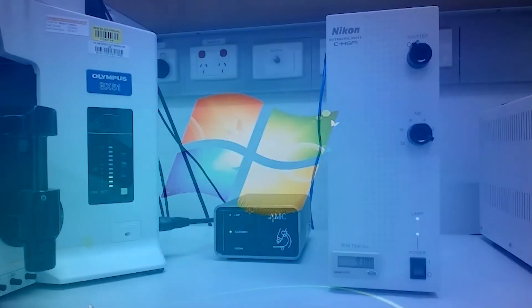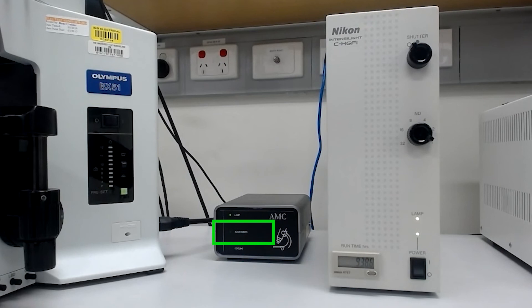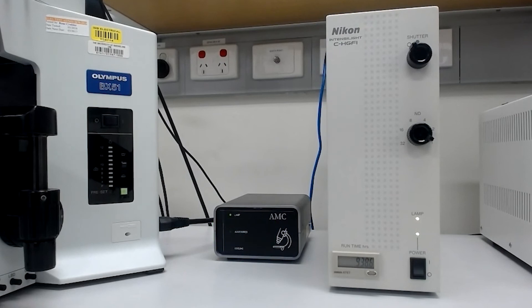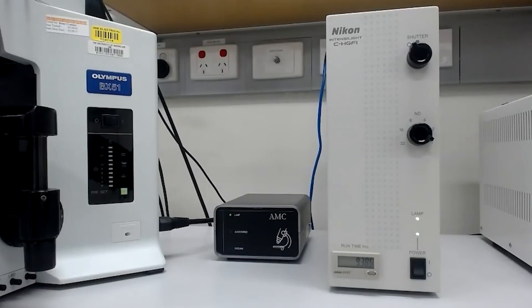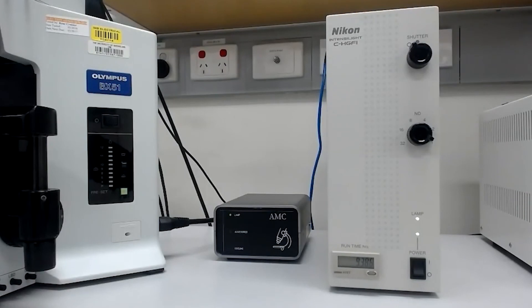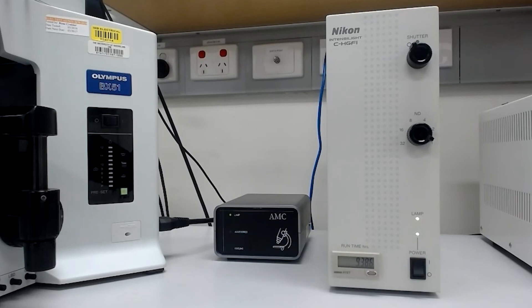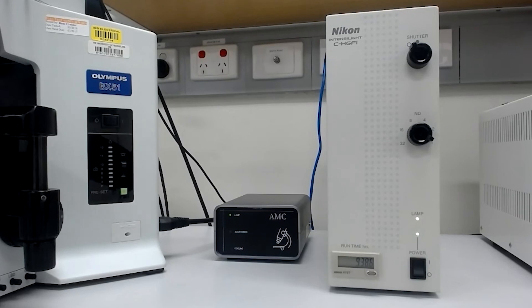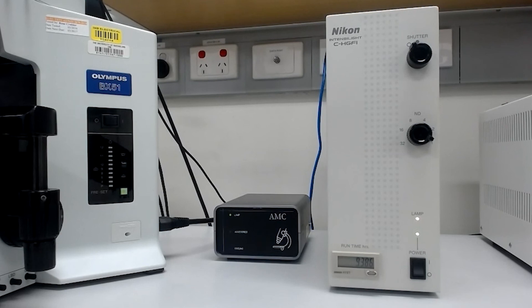When you log out of the computer, the power to the microscope, bright field lamp, and accessories will automatically turn off. You may notice that the lamp does not always shut down when you log off the PC. This is because you have not yet reached the minimum 30-minute lamp runtime. The lamp will automatically shut off when this time has been reached.